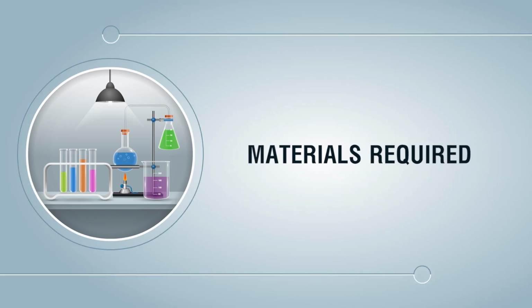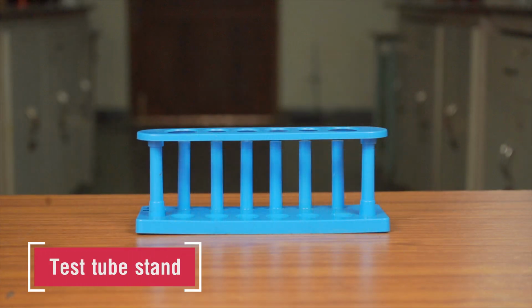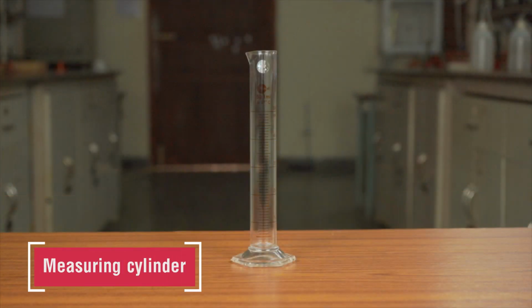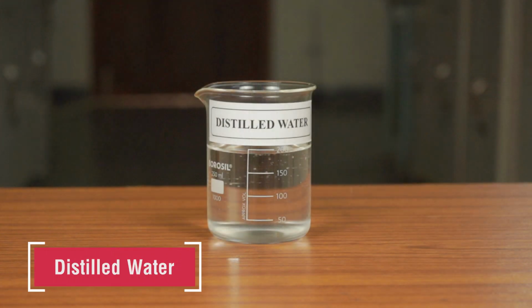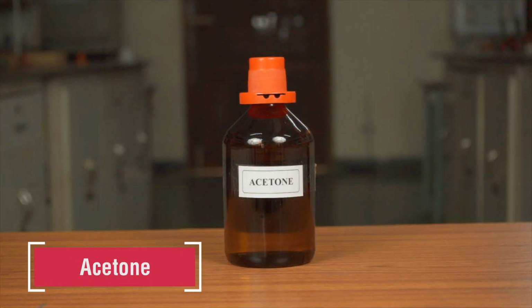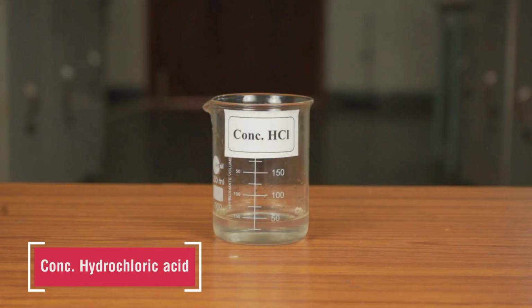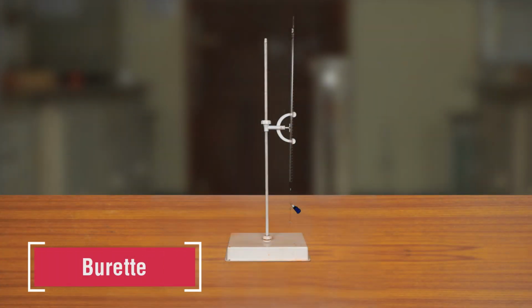Materials required: test tubes, test tube stand, measuring cylinder, distilled water, acetone, concentrated hydrochloric acid, cobalt chloride solution (60 ml of acetone plus 0.600 grams of cobalt chloride), burette.